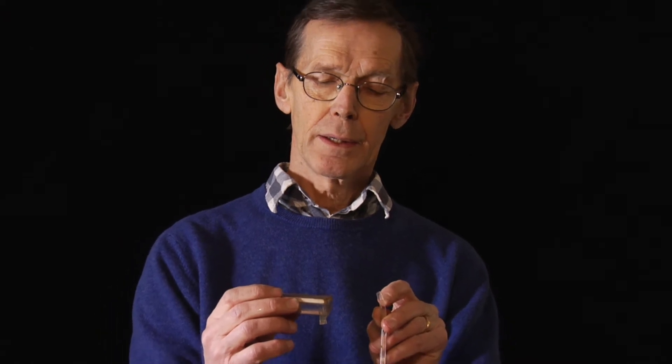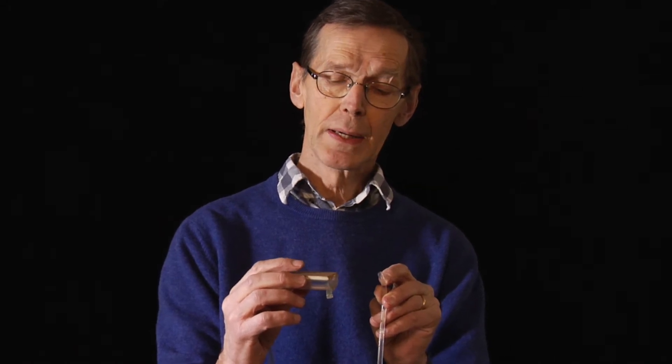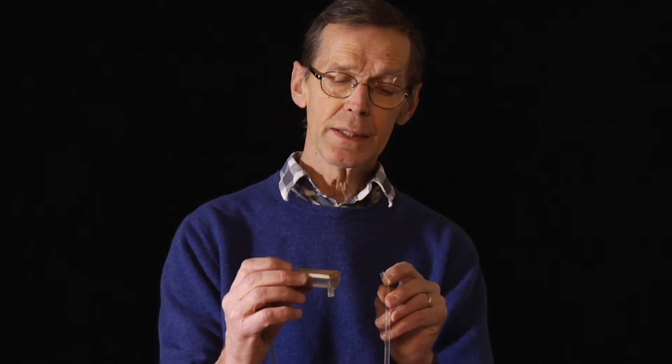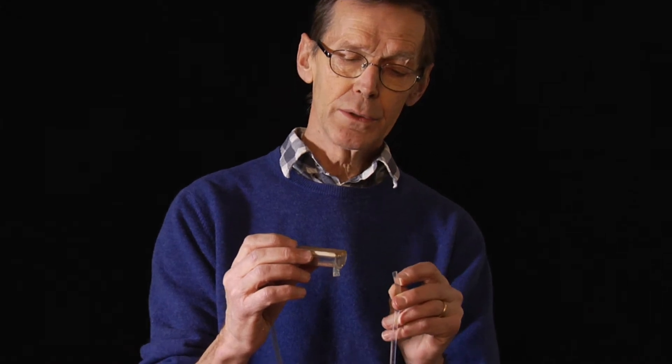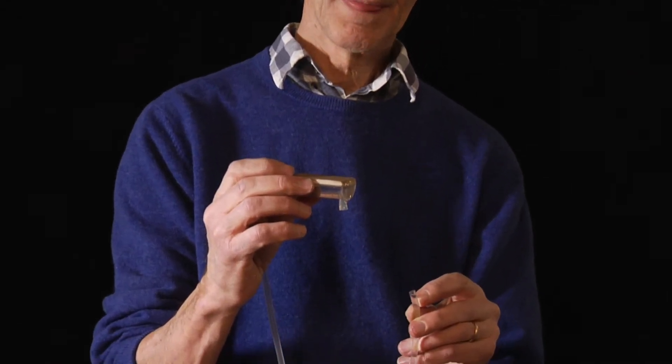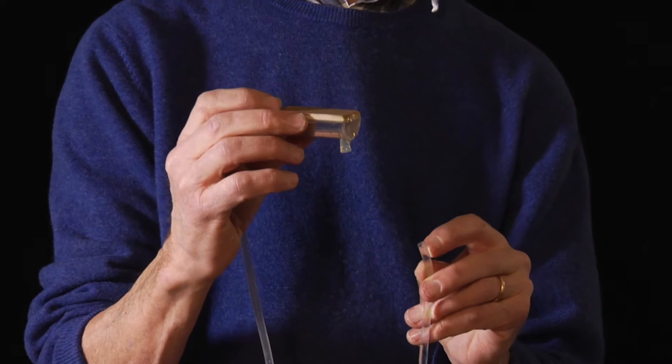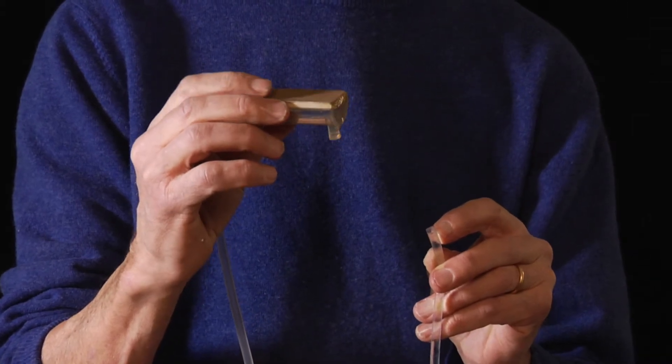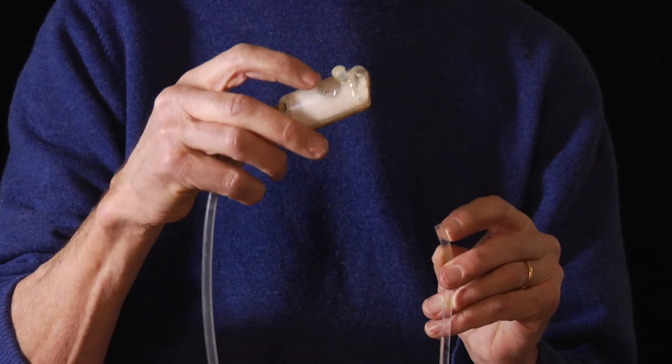We can regard this plate as a soil with rather fine pores. If I lower the tube with water level at the end 10 centimeters, nothing happens. I turn the plate around for you to see better.